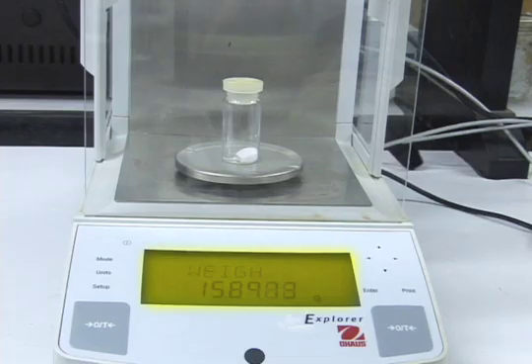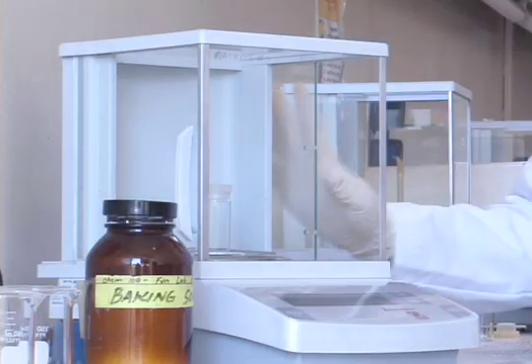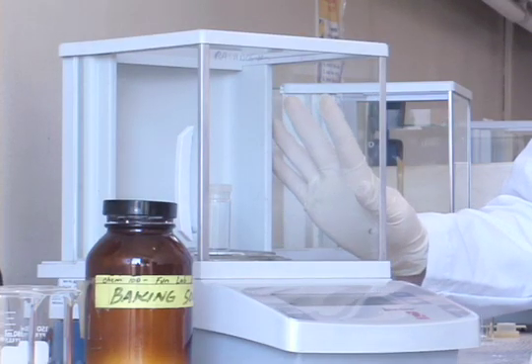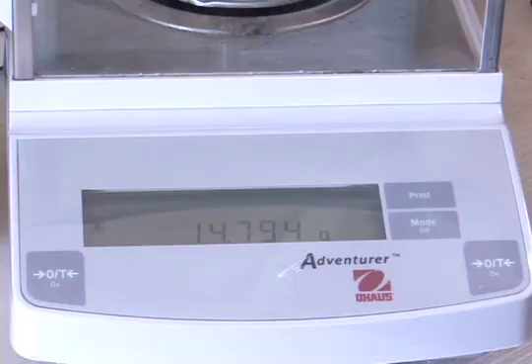Number three, since these scales are very sensitive and may be affected by air movement, make sure that the doors to the container around the balance pan are always closed. Number four, leave the scale on. The instructor will turn them off at the end of the laboratory period.